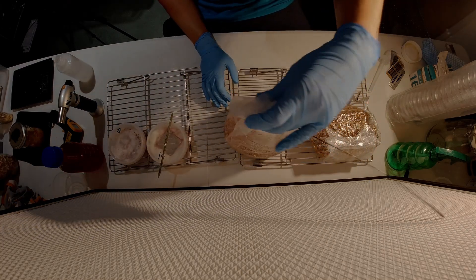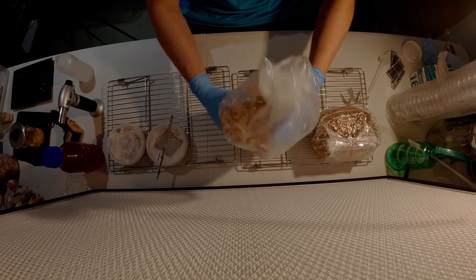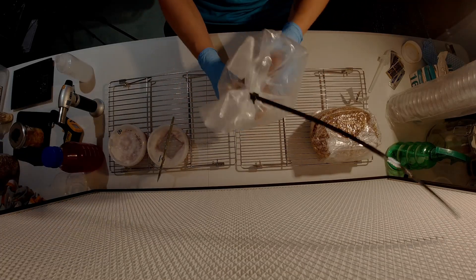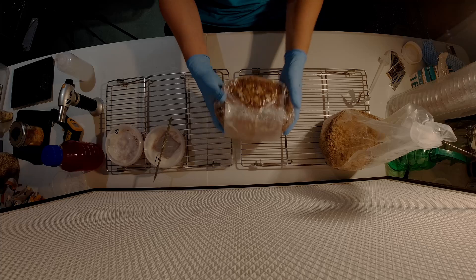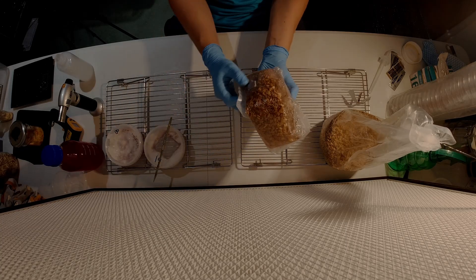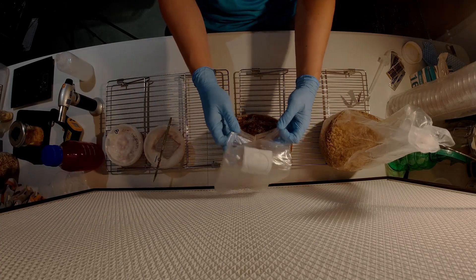If you're working in a still air box, close off the opening of the grain bag immediately using a zip tie. Don't worry about mixing the grains and the agar inside the bag just yet — you can do this later when the bags are all complete and everything is secure. Quick and minimal exposure is key in a still air box. That's one of the main benefits of using a flow hood: you can be a little bit more relaxed when it comes to exposing your work, however it's still important to make sure that you're organized and you don't obstruct the airflow.